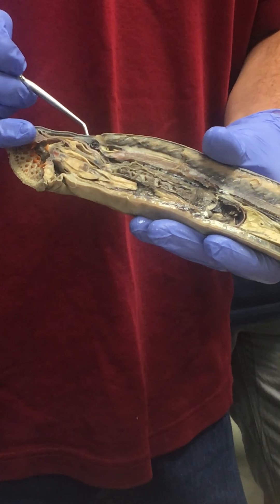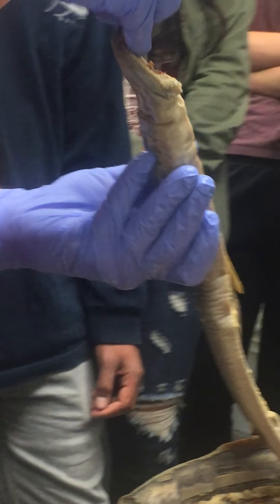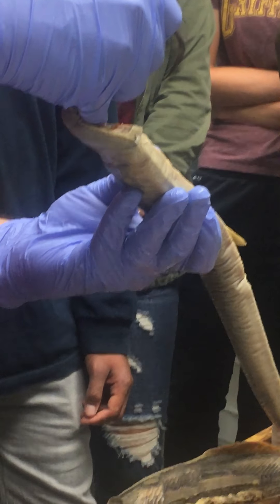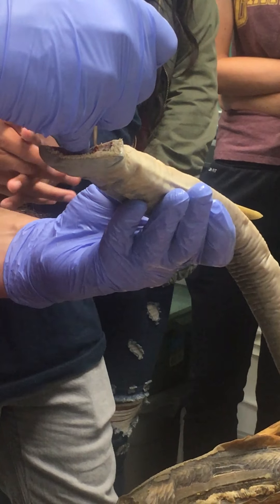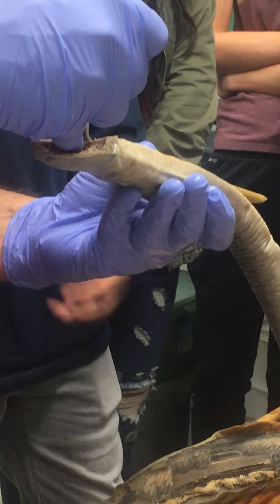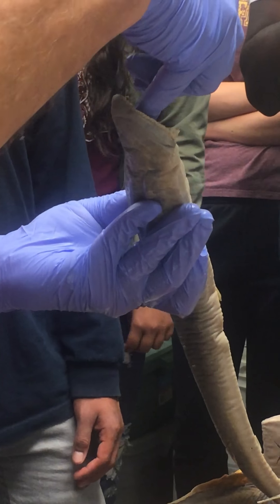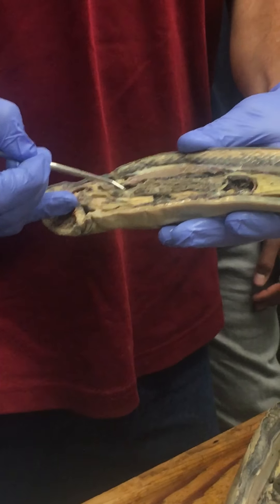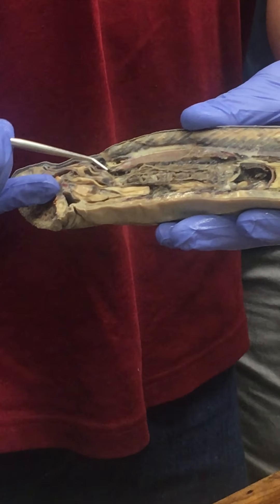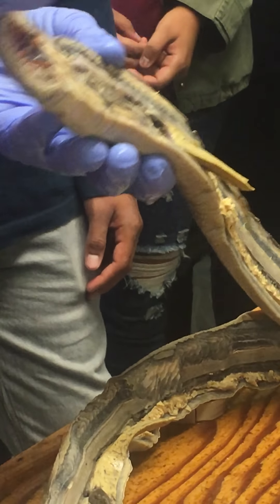The median nostril leads down into the olfactory sac, and then the olfactory sac actually has an outpocketing that continues down further — it can be seen here in front of the notochord and around down under the tip of the notochord. That's called the hypophysial pouch, right here.